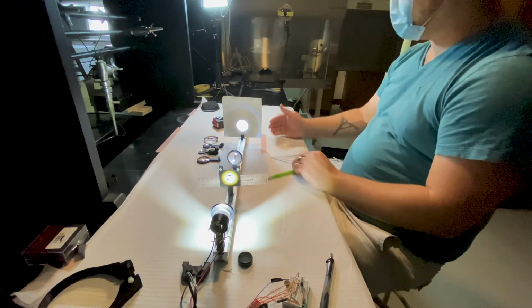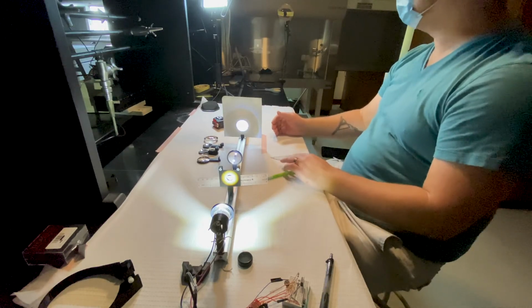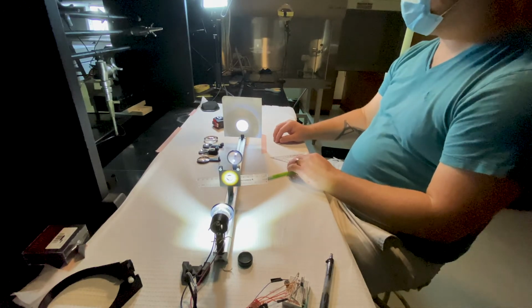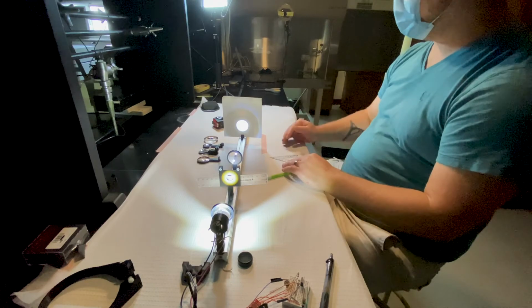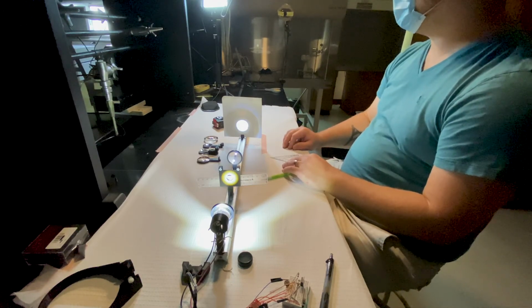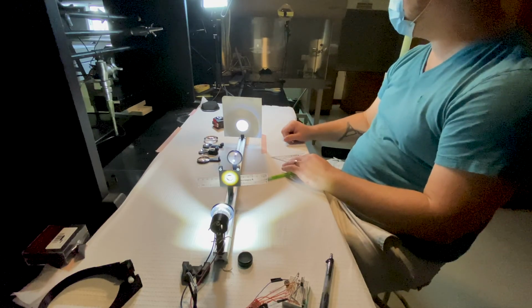We can do that with analog methods, but a more precise way is to do it in a similar way to what we've done on your computer with Fiji, which is to do that digitally. So that will conclude Lab 2, and that will bring us into Lab 3, which is calibrating the magnification of your system.